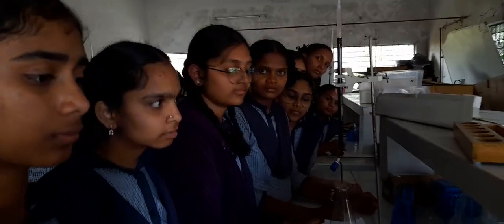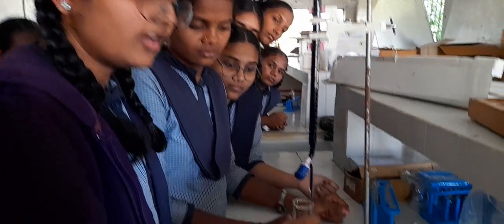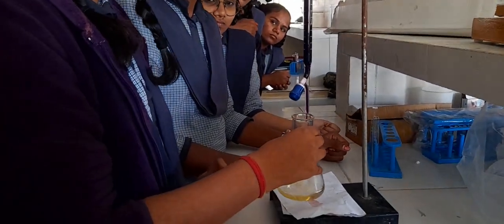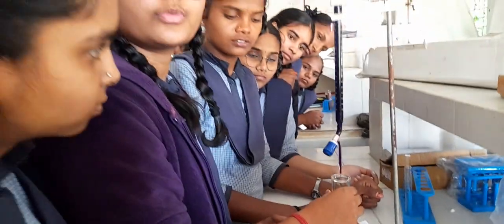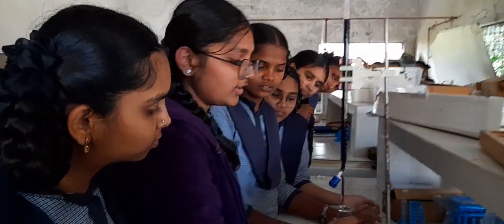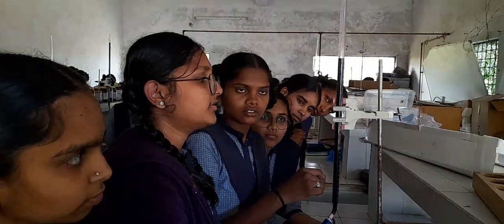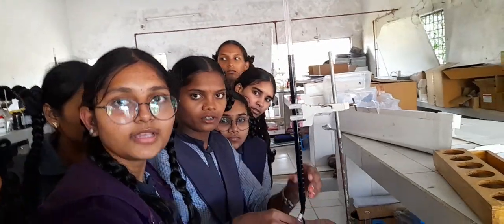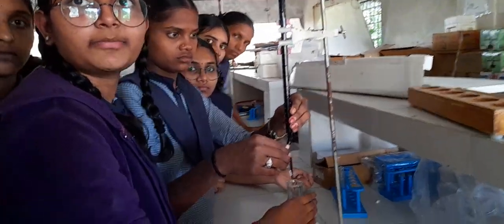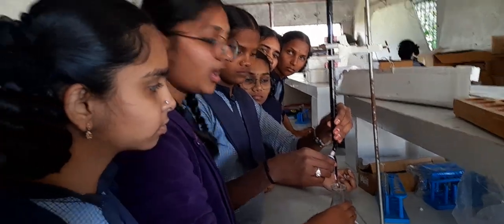Yes, Shravya, what is your experiment for today? Ma'am, firstly we have prepared 20 ml of ferrous ammonium sulfate. Then next we added 10 ml of dilute H2SO4. What is it that you have taken in the burette? Potassium permanganate. Okay. Now are you titrating it?